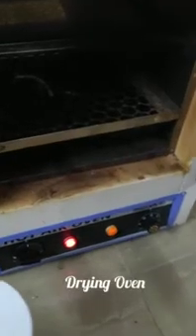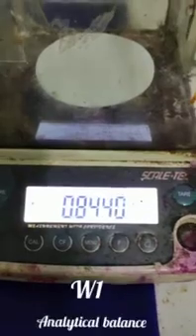Let us start the experiment. First, the filter paper is dried in an air oven for one hour at 103 to 105 degrees Celsius. It is then cooled in a desiccator and the weight of the filter paper is noted as W1.